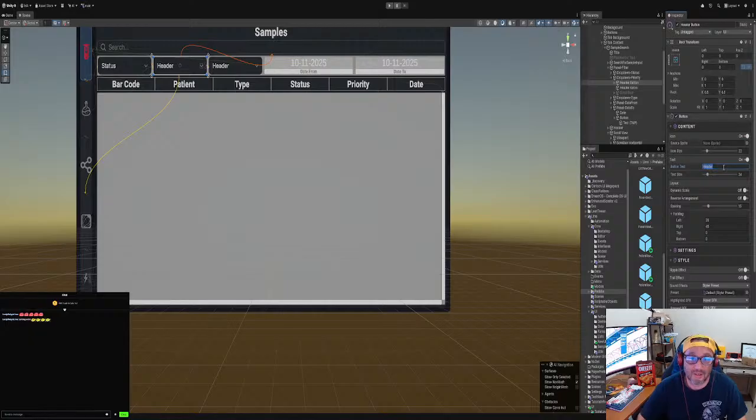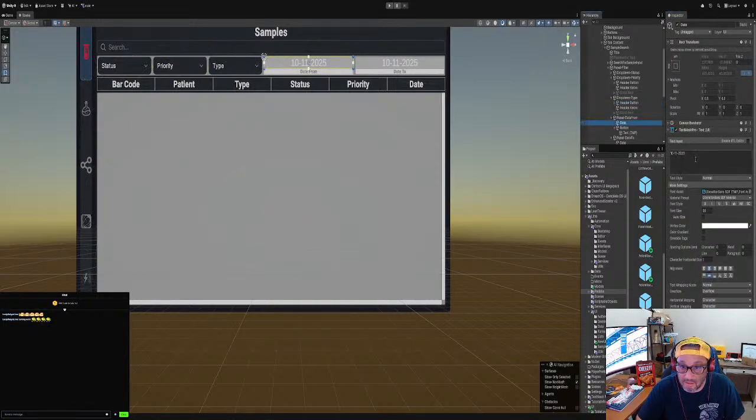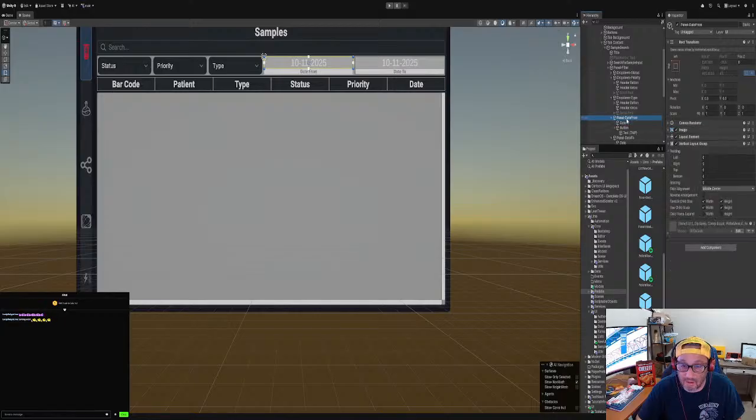Oh, here it goes. Yeah, button, which is priority. And this one is type, and then this one is from date. Oh, okay. This one we're not. Okay. So we got type, priority, and let's just run it to see if it's actually clearing and then giving the options that we want. Right?